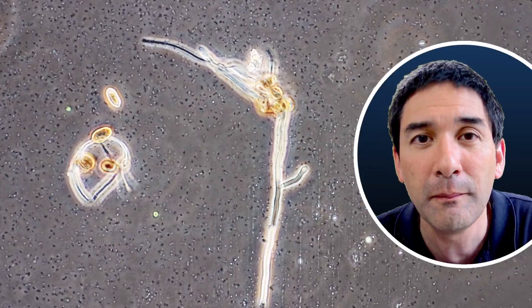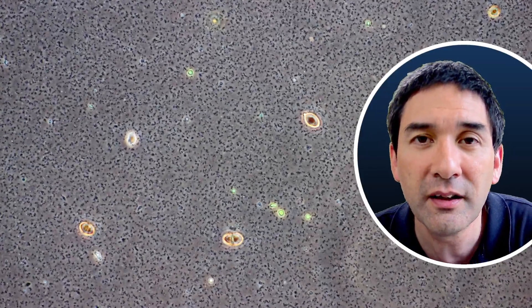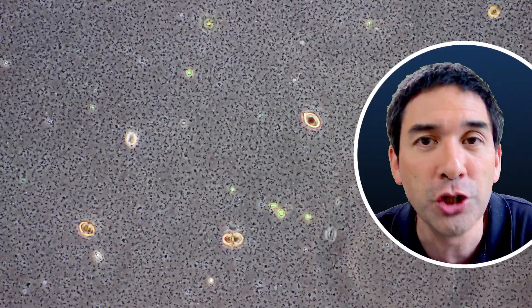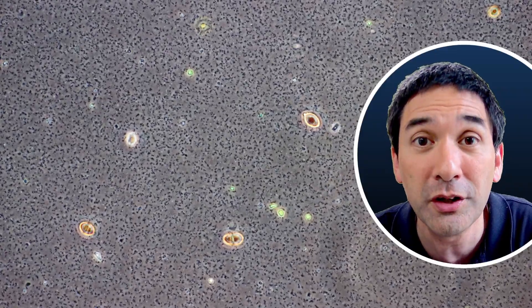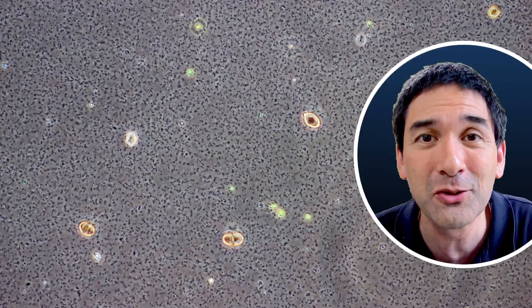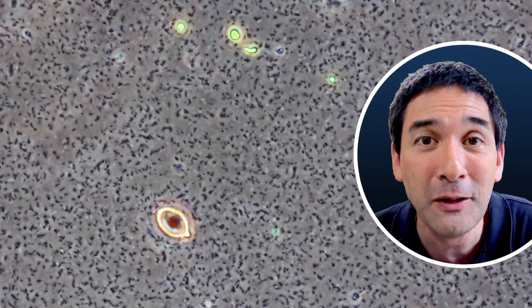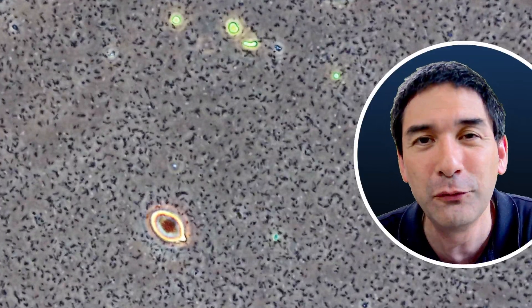By the way, I've used phase contrast here, which allows you to see the bacteria much better, and simply the sheer number of bacteria is quite remarkable. On a moldy cucumber you can not only expect to see mold but also billions of bacteria that are growing there.